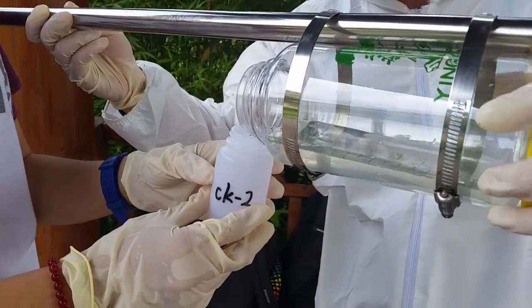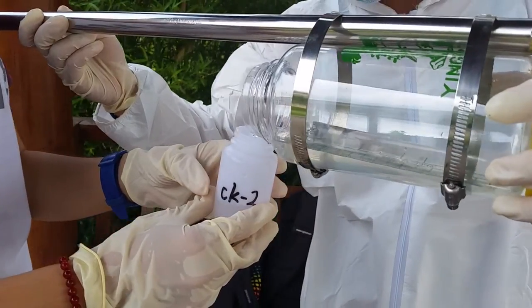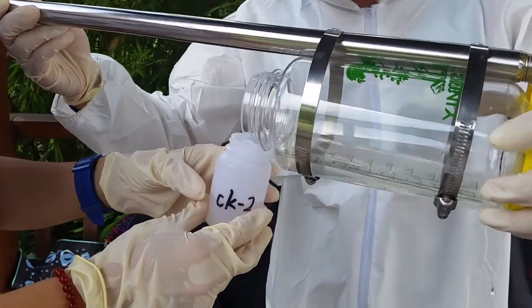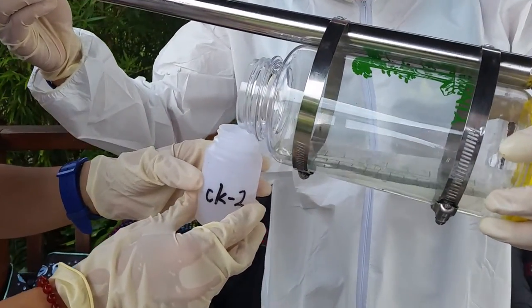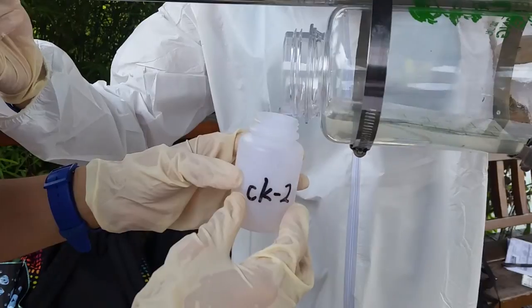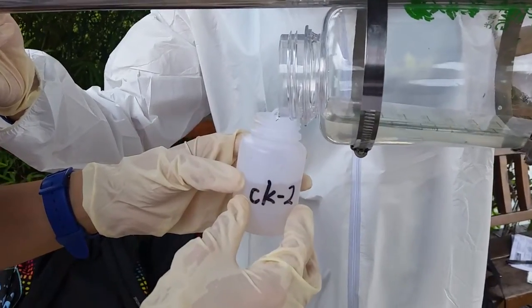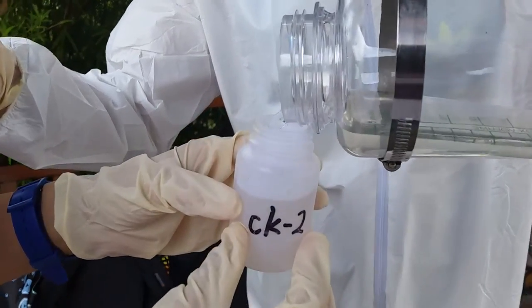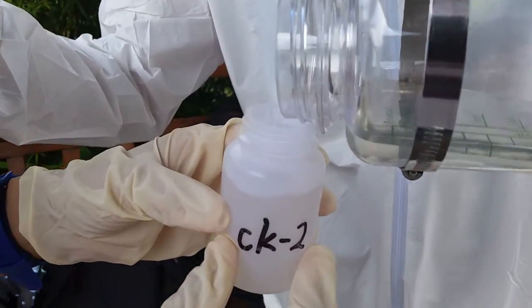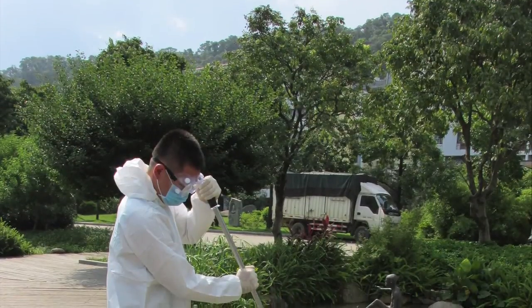For further QA/QC purposes, a split sample should be taken every few samples. To take a split sample, simply pour one sample from the collected water in the dipper and then pour another, both of appropriate size.